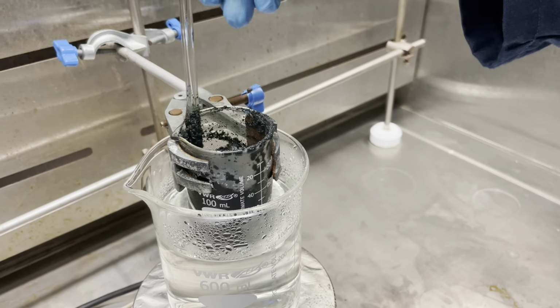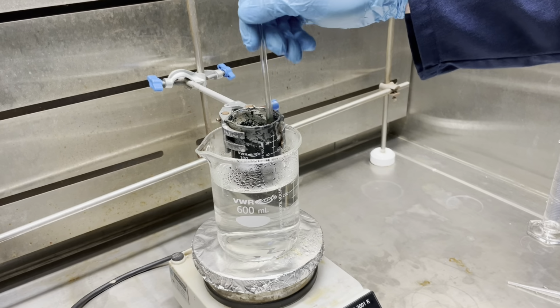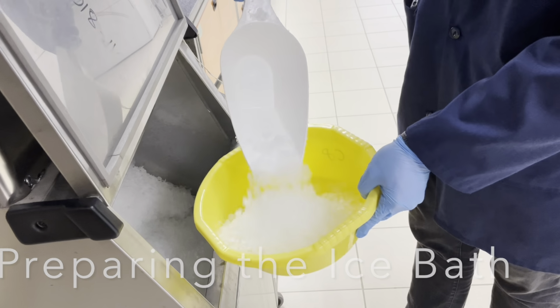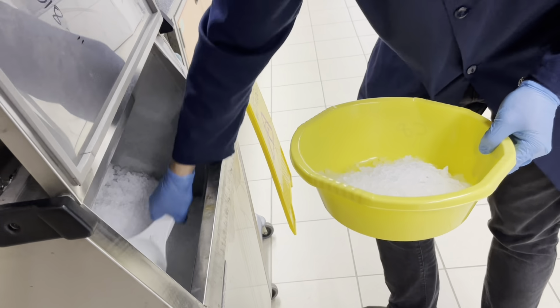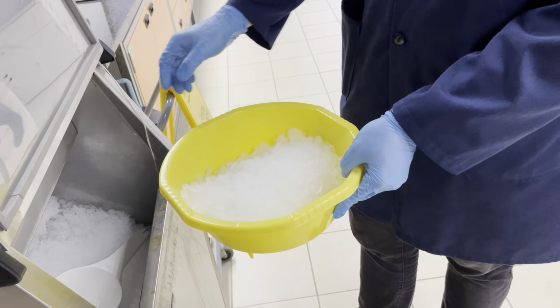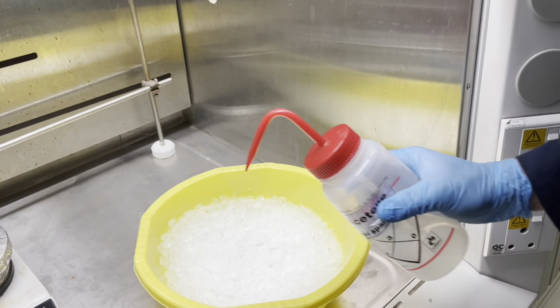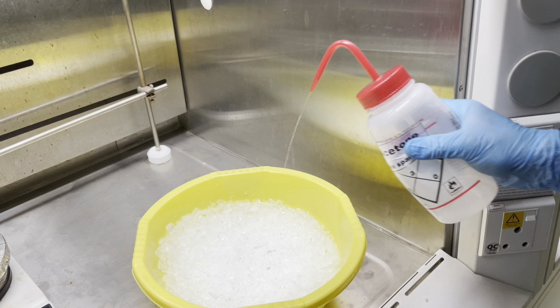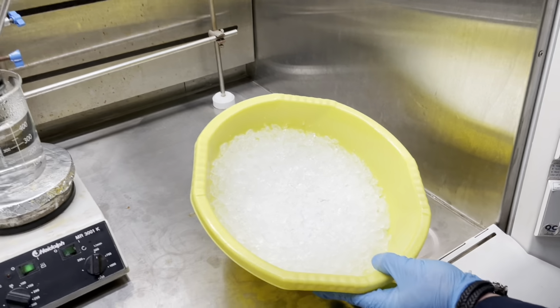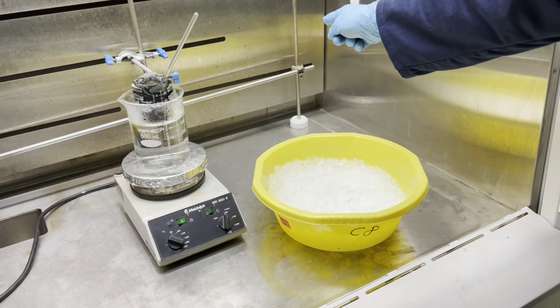Next, we will show you how to create your ice bath for the cooling process. Use your plastic bucket and collect ice from the ice vendor. Approximately 1.5 scoops will be sufficient for this. Next, take acetone or salt, depending on which is provided on the day, and add a little bit of it on top of your ice. This will allow the mixture to crystallize at a colder temperature than what the ice necessarily is able to provide.